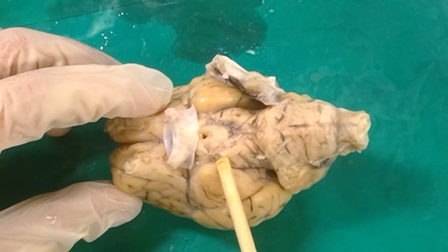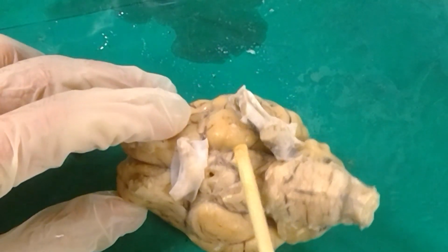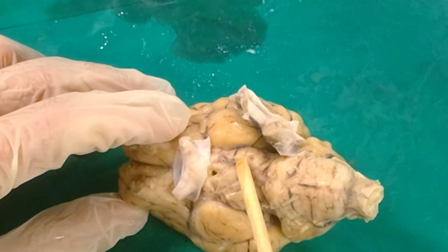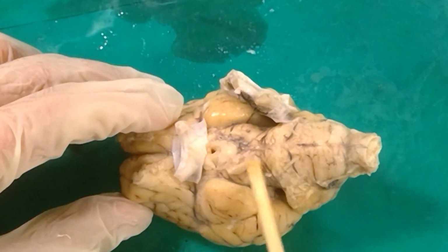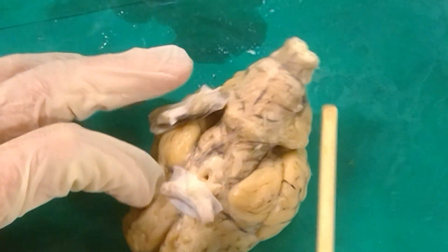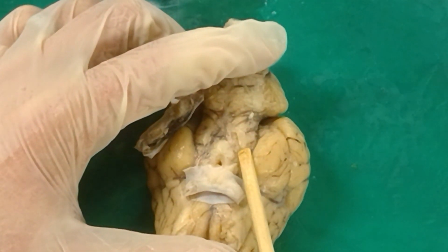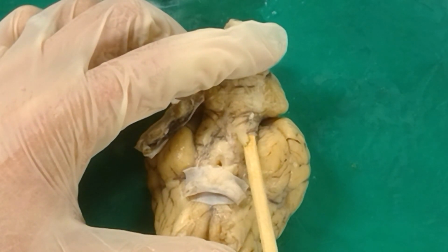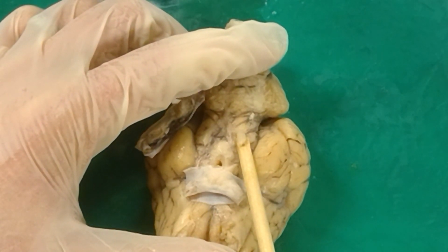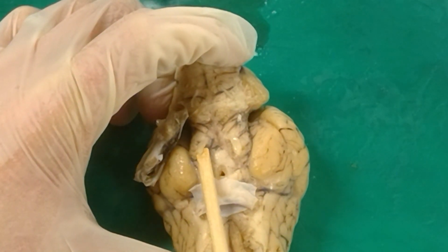Just lateral to the mammillary bodies are some bulges. We've got this bulge happening right here, and a bulge happening right here. These are known as the cerebral peduncles, or as I call them, the cerebral peduncaduncs. They have these little fettuccine-looking noodle things happening right here. They're very flat and wide. There's also one right here.